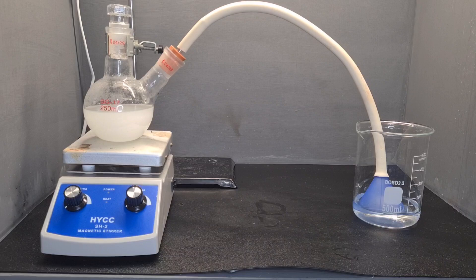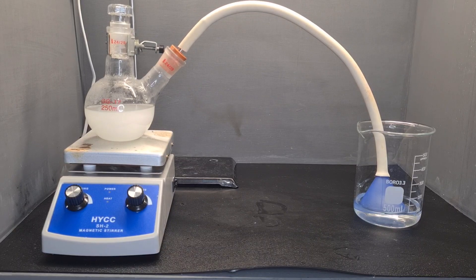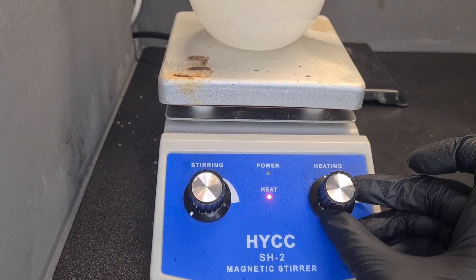And here's the overall setup. Now I'm going to turn on the heating.